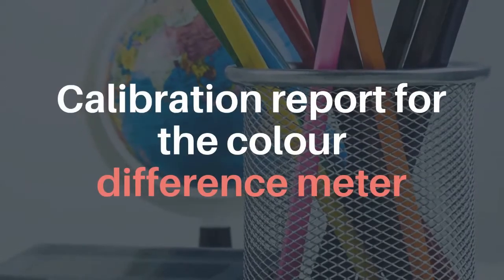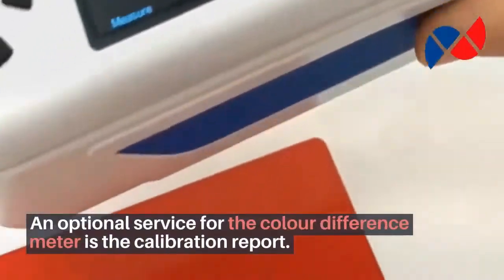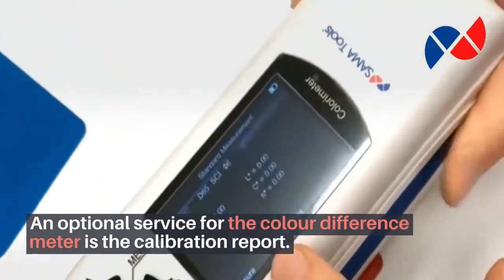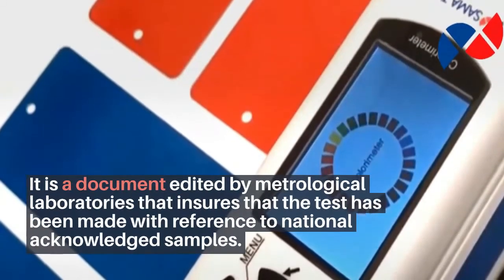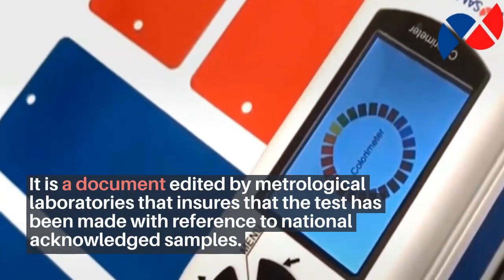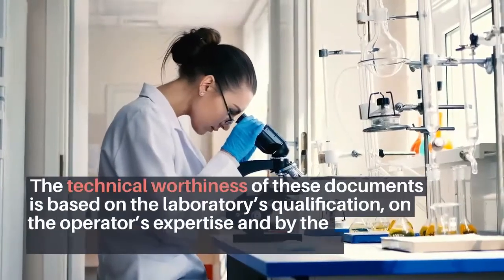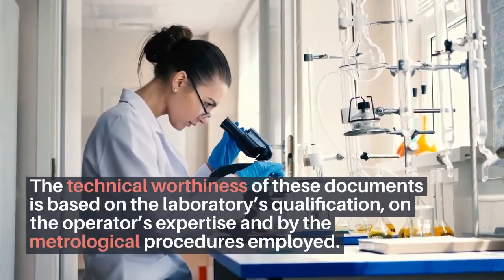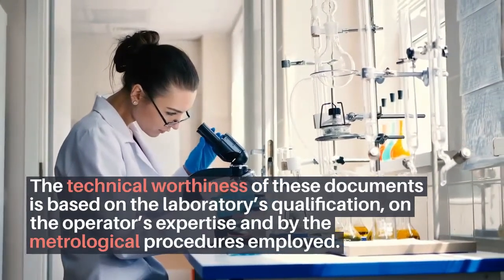An optional service for the color difference meter is the calibration report. It is a document edited by metrological laboratories that ensures that the test has been made with reference to nationally acknowledged samples. The technical worthiness of these documents is based on the laboratory's qualification, the operator's expertise, and the metrological procedures employed.